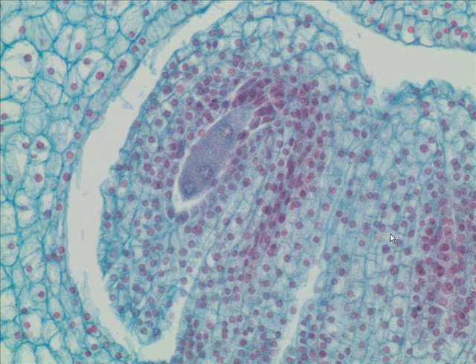And so finally, here's an ovule up close and personal. We see part of an ovule over here, but here's a complete ovule. Here's kind of like the neck. Here's like the head. There's the surrounding what over here? Ovary, yes. And so something is developing within this ovule. What is it? It is what we call the what? An embryo sac. Yes, indeed. So an ovule with its embryo sac.